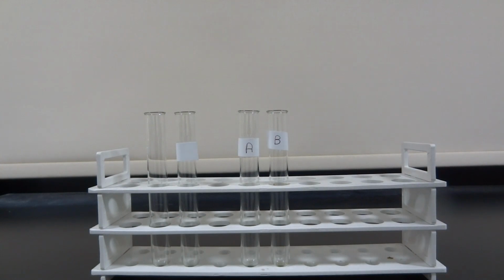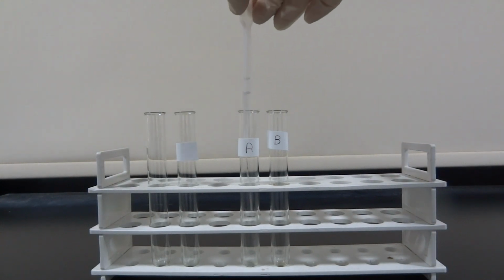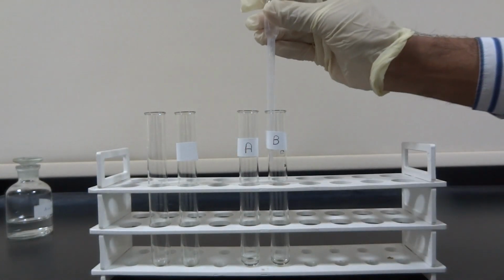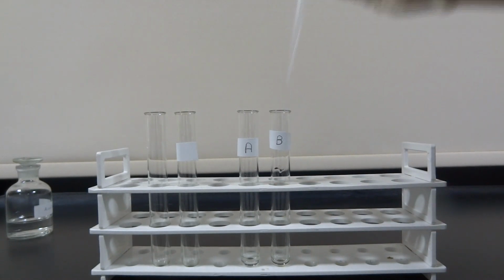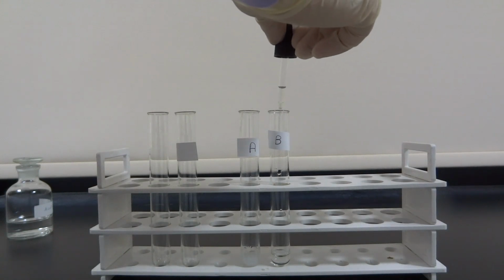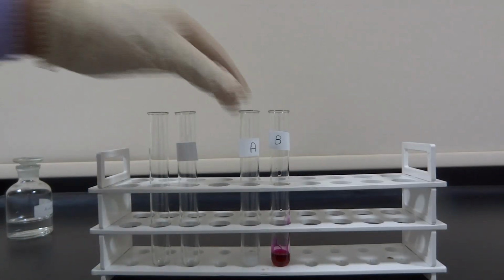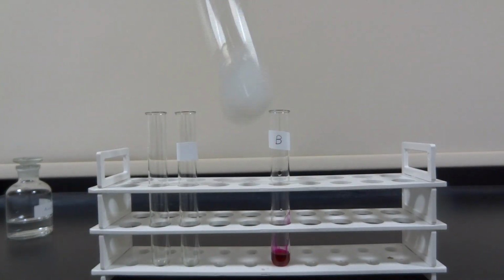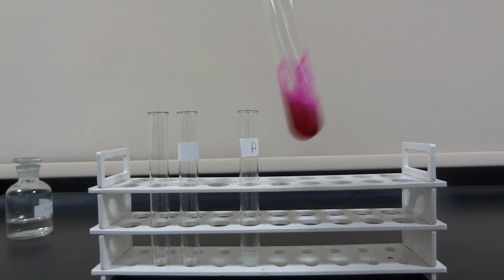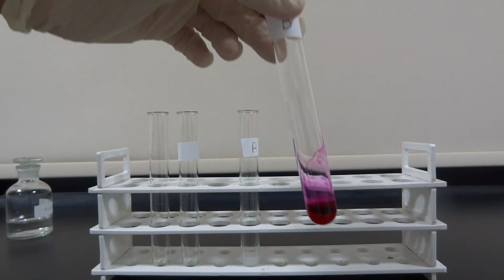In this experiment, the scientist would like to detect which solution is acidic, solution A or B. Already the scientist knows an indicator color that changed non-acidic solutions into pink. So he took a few milliliters of each solution in a test tube and added a few drops of the indicator color by using a medicine dropper. As solution A stayed colorless in the presence of the indicator color, it's acidic, and solution B turned pink, so it's non-acidic.